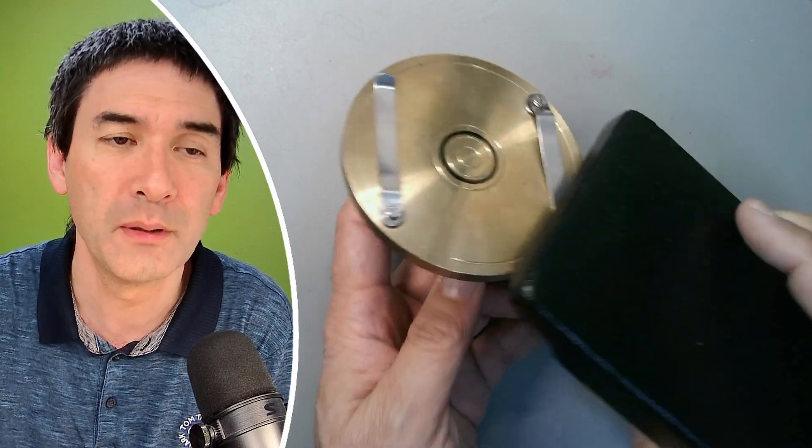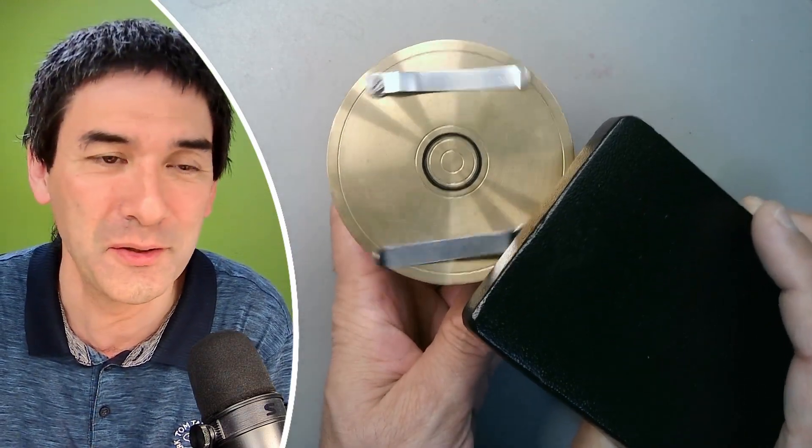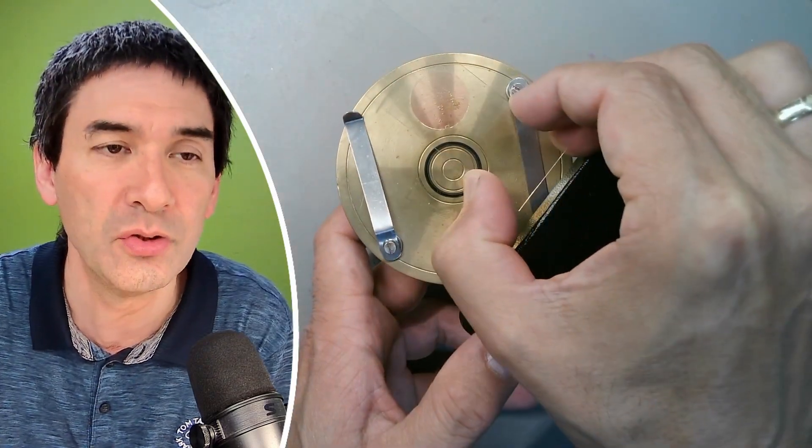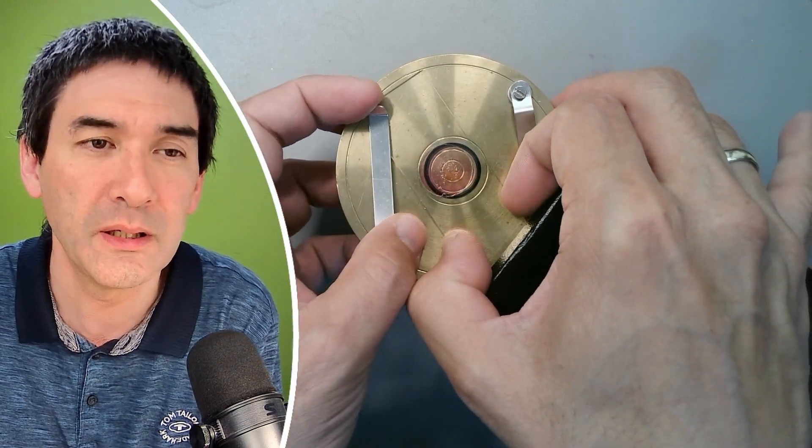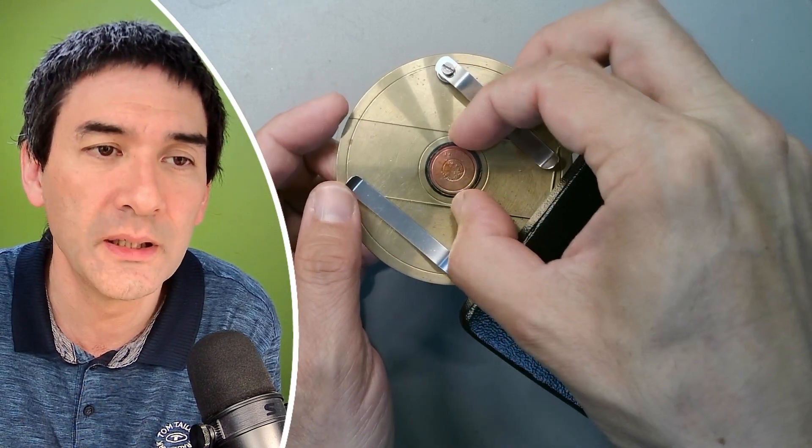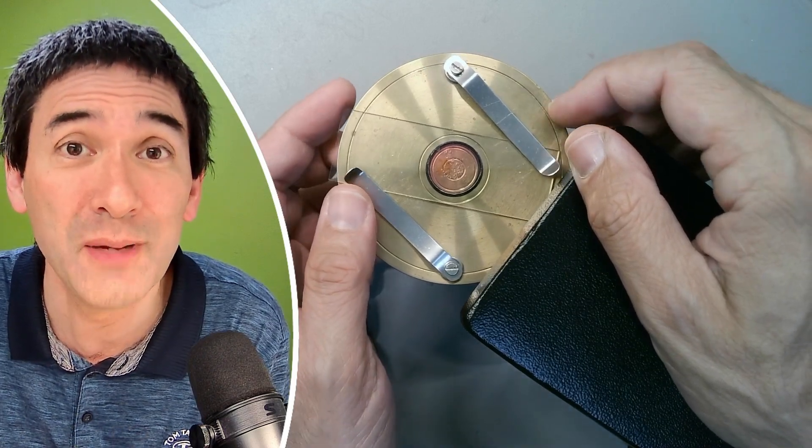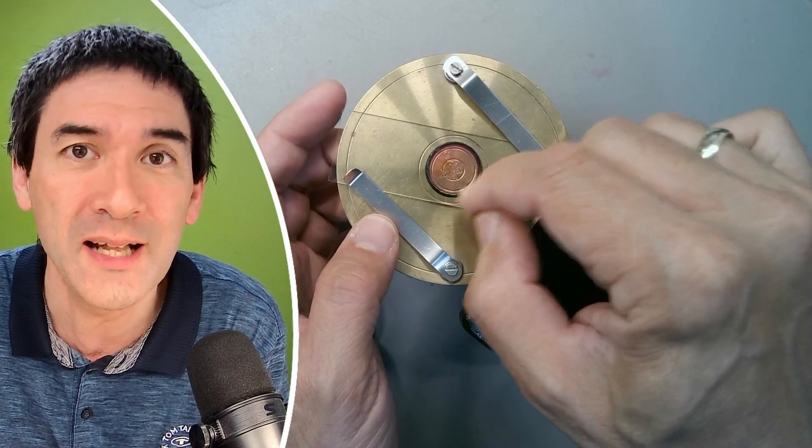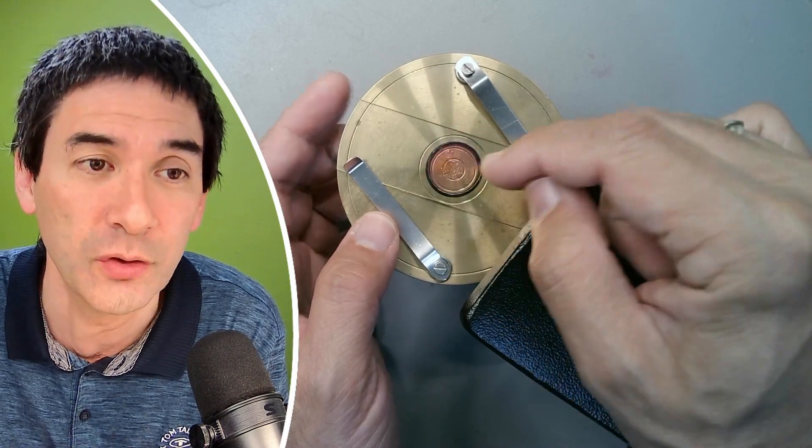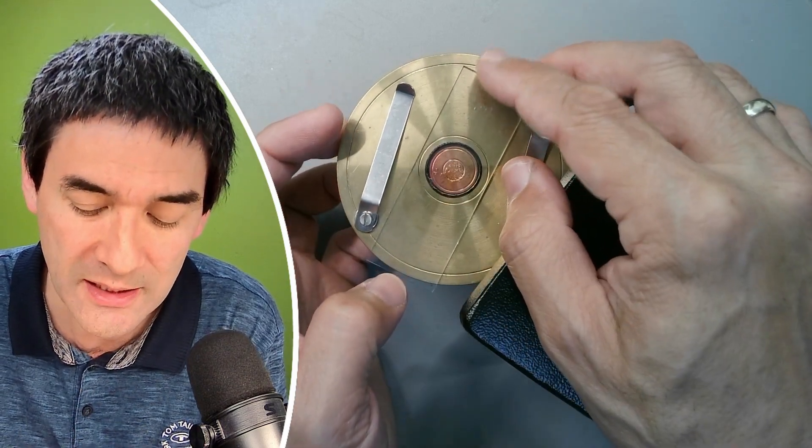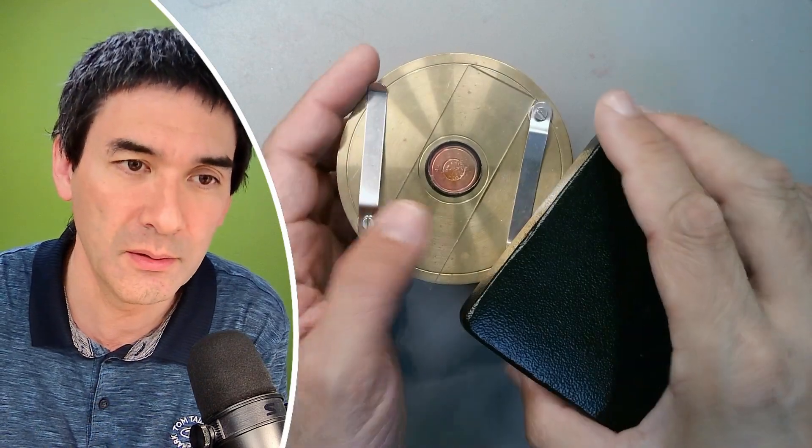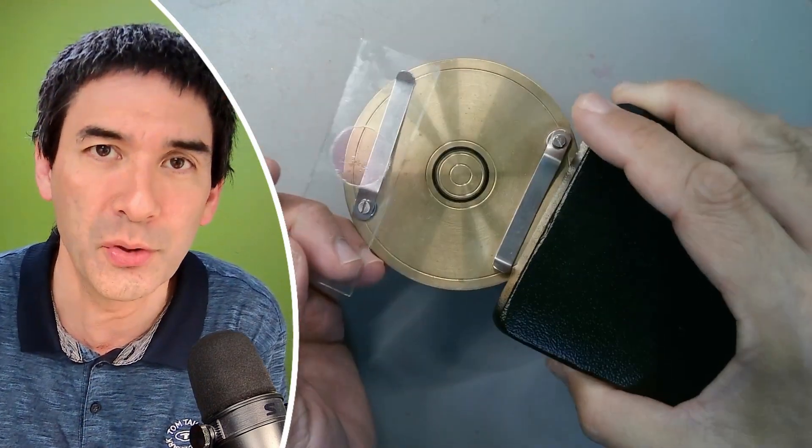Some people like to make them, you can make it yourself by using a fidget spinner or some other method. I made a black circle here simply to help it centering. And what I'm going to do now is I'm going to put this one on here and have to make sure that this is kind of properly centered so that when it spins that essentially the cover glass is properly aligned. And what we have here already is a slight problem, and that is that you see it's not centered properly, so essentially it will bump on here on the side, and it's not possible for me to ring the slide now.